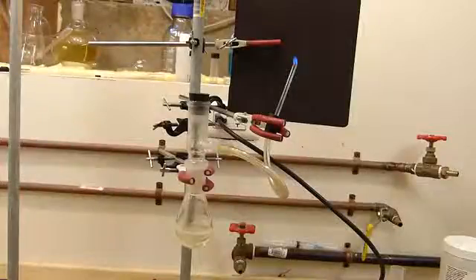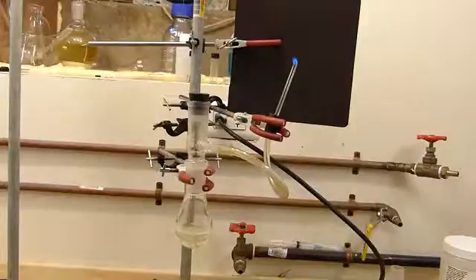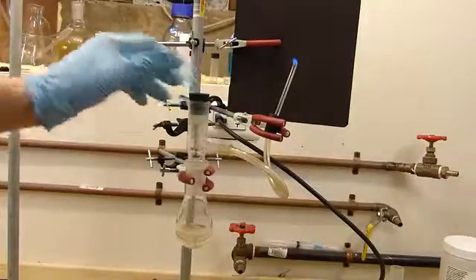I'll be using carbon monoxide in several upcoming videos, but I decided that the procedural details for making carbon monoxide would be best left to a separate video, since it might clutter up a different video. So anyway, that is the production of carbon monoxide.